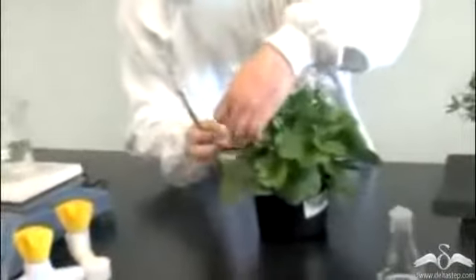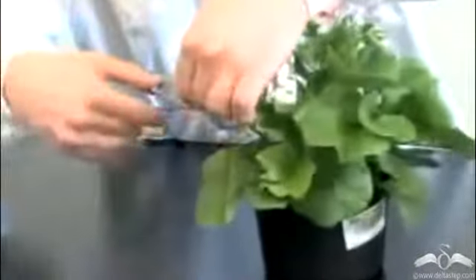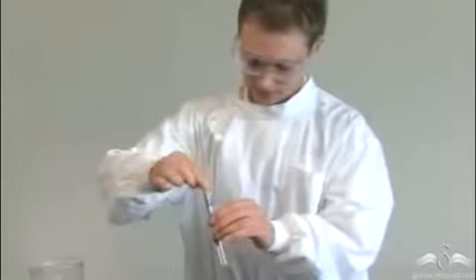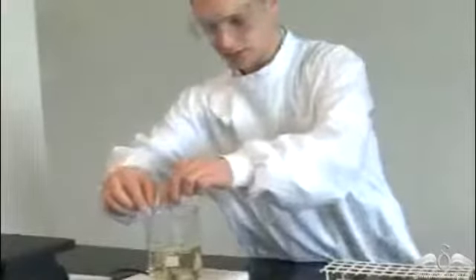The leaf which was exposed in sunlight was cut and kept in boiling water. And also the leaf which was wrapped in foil paper that was not exposed to sunlight was cut and put in the boiling water. Now, after being kept in the boiling water, next, take out the leaves and put them in test tubes. After putting them in test tubes, pour some alcohol in the test tubes. And place these test tubes in boiling water once again.